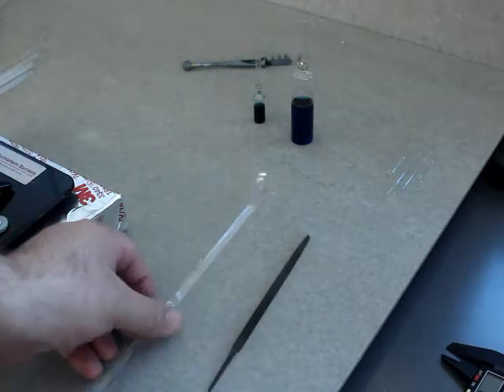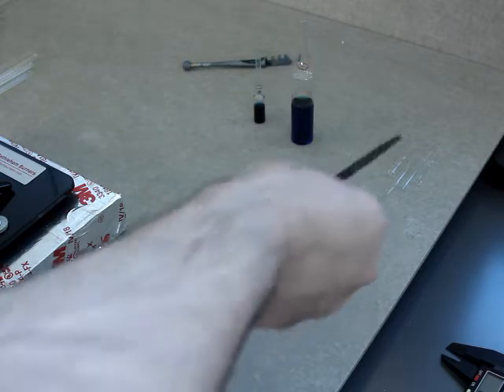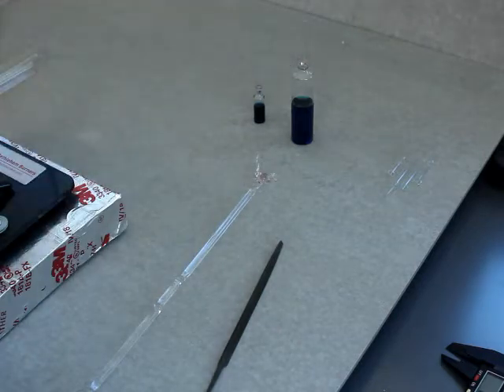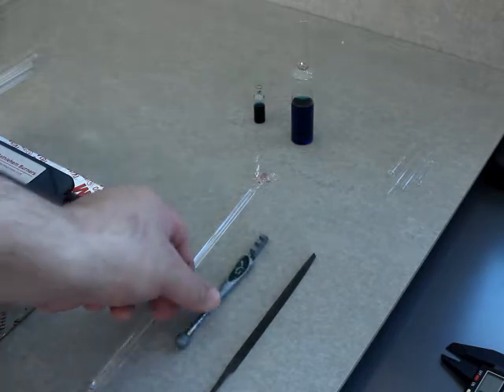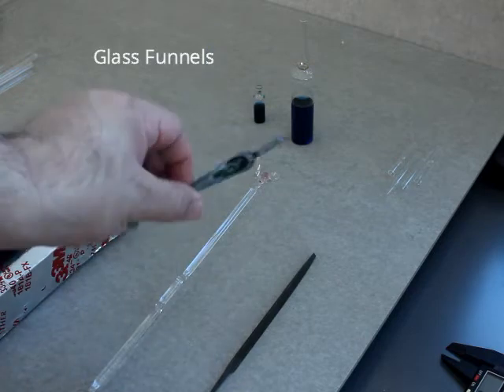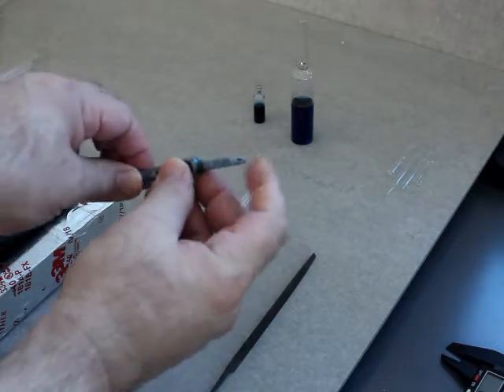The steel triangle file is an excellent piece of equipment to use for cutting glass tubing and glass rod. However, you can also use a glass cutter, which has a little scoring wheel on it. This is also used for flat glass, but it does exactly the same job. There's a steel wheel right there — I take this and I can actually hear it — and there's the white line of the score mark.